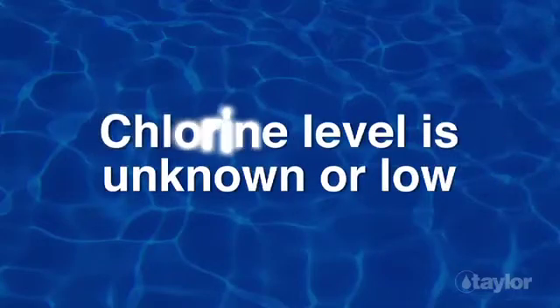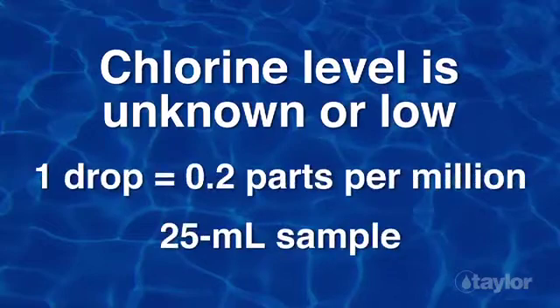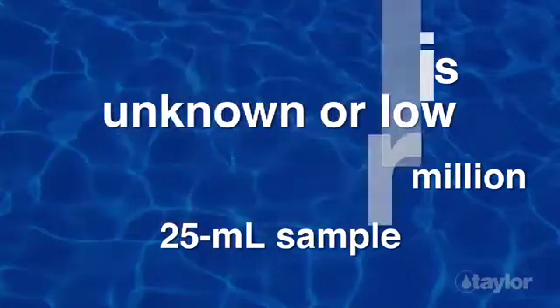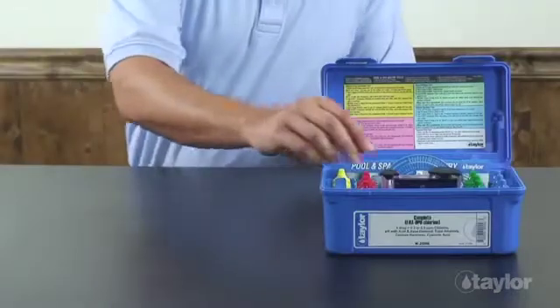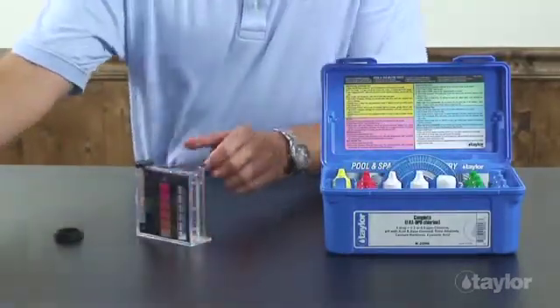If you do not know the chlorine level or you suspect it is low, use 1 drop equal to 0.2 parts per million and a 25 ml sample. This demonstration assumes the chlorine level is unknown. Rinse and fill the large comparator tube to the 25 ml mark with the water to be tested.